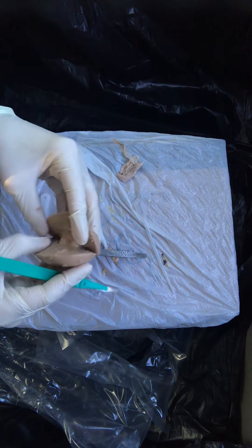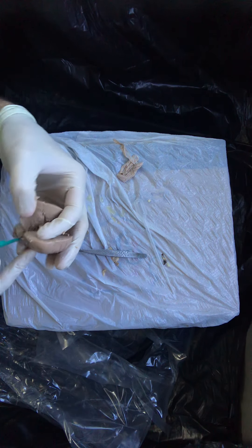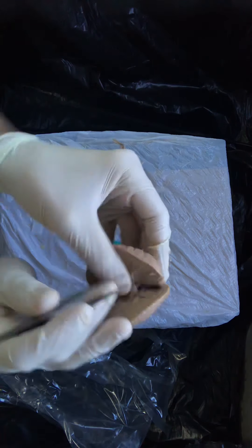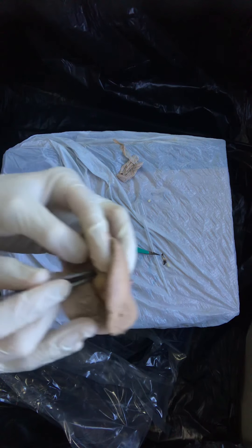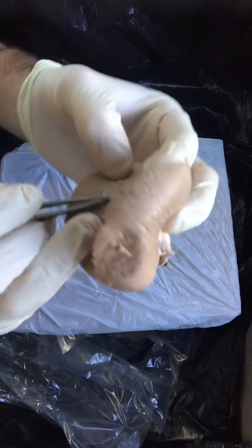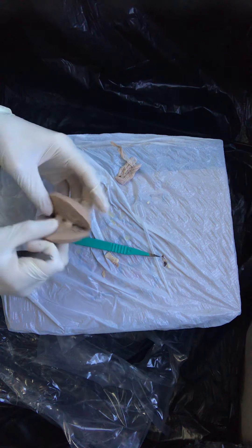Let me keep developing this incision and give you a view. Really the important thing here is to go little by little. What I really want to point out to you here — underneath my pickups right here — there is a hollow, a small hollow structure joining this larger collecting system. That would be like a minor calyx entering into, or really minor and major calyces, sort of blending or joining together to form this larger renal pelvis.